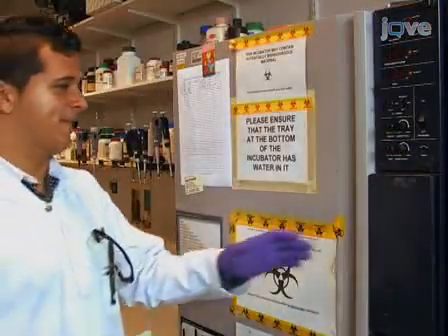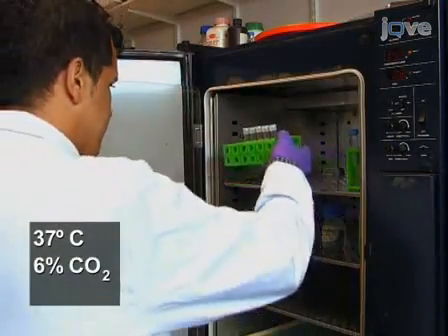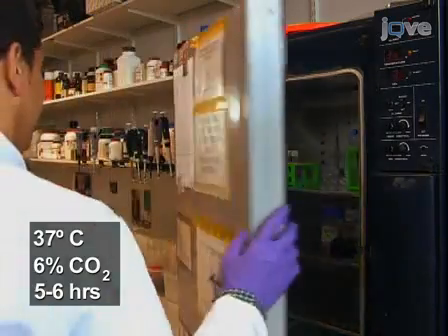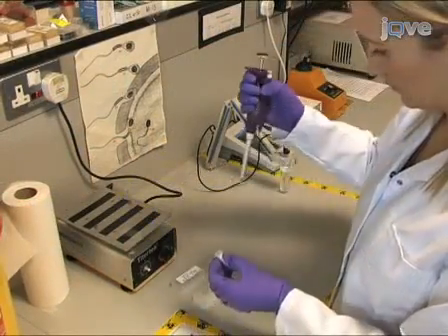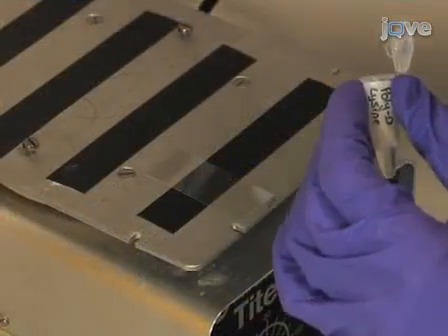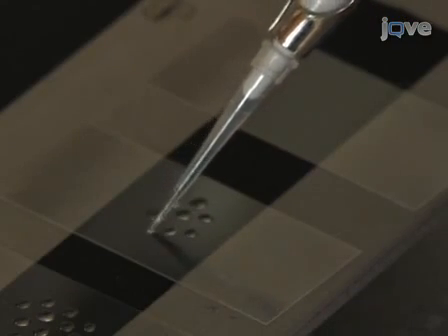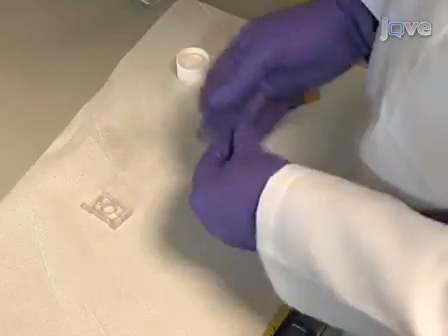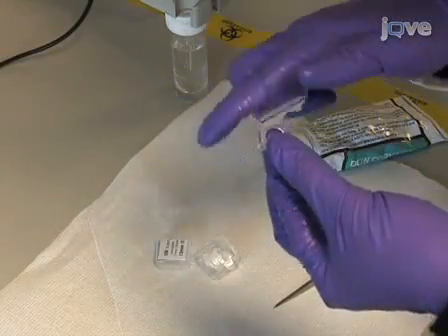If the response of capacitated cells is being studied, incubate the tubes for 5 to 6 hours at 37 degrees Celsius and 6% carbon dioxide to allow capacitation. Apply 10 microliters of 10% poly-D-lysine as a number of small drops to the center of a 22 by 50 mm No. 1 cover slip and allow it to dry completely. Use vacuum grease to attach the cover slip, treated side up, to a perfusible imaging chamber built for the purpose.